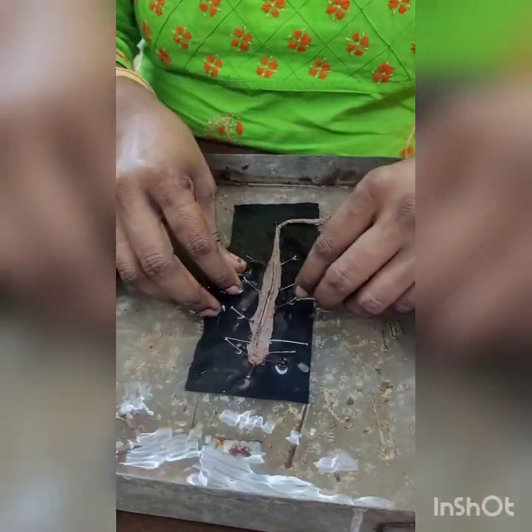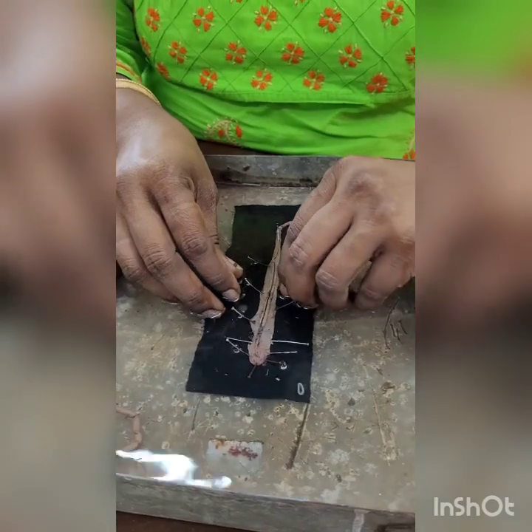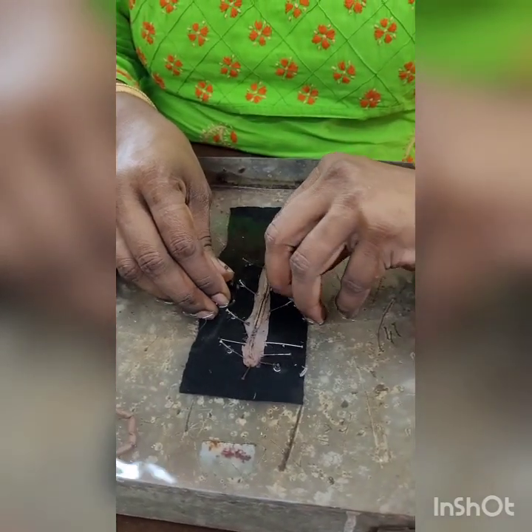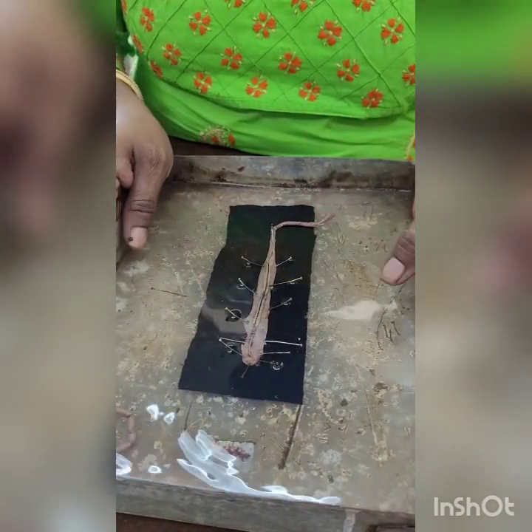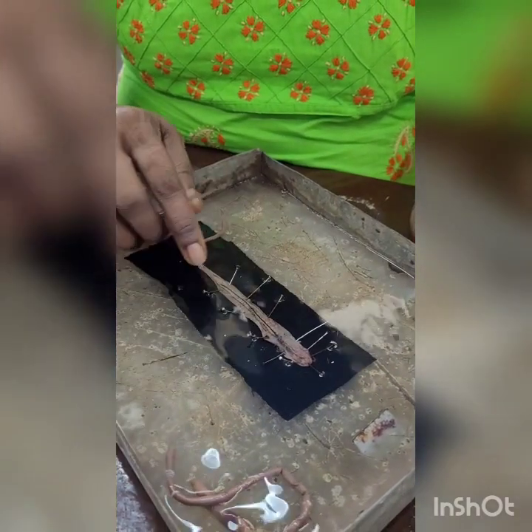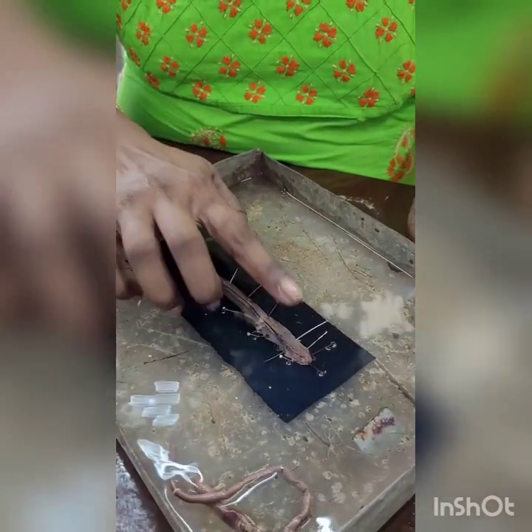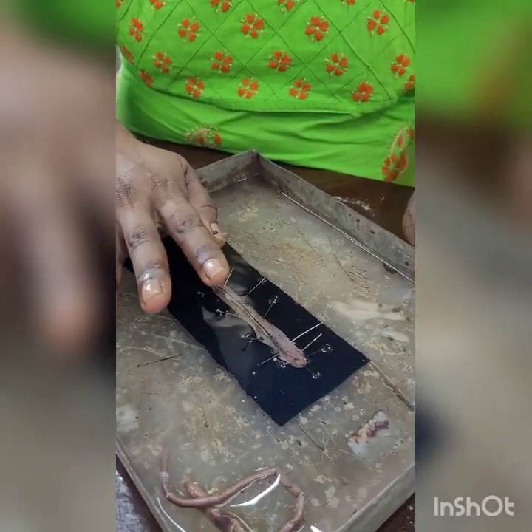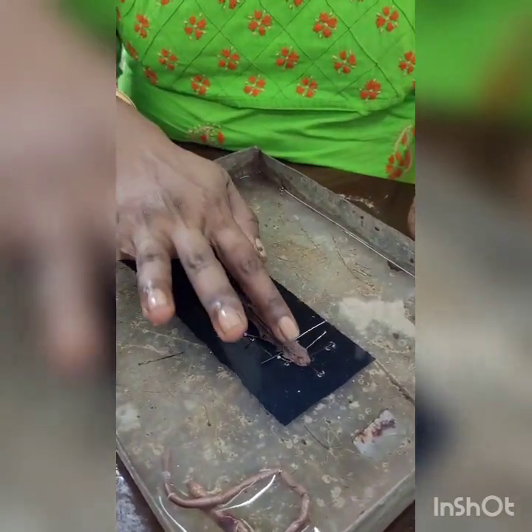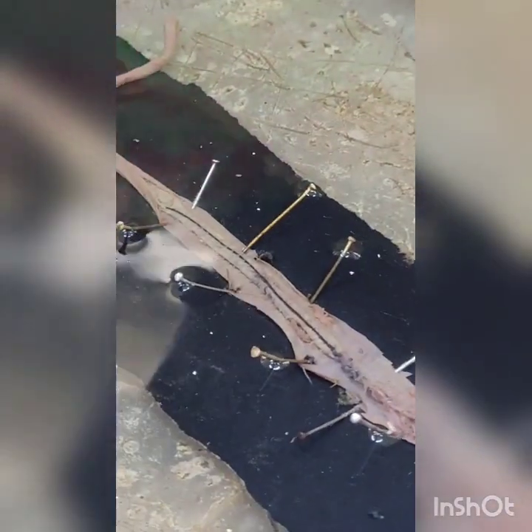We open from the dorsal side so that the digestive system can be exposed properly. Anytime you are going to dissect the earthworm, you open from the dorsal side so that the nerve cord remains intact and you can see the digestive system properly.